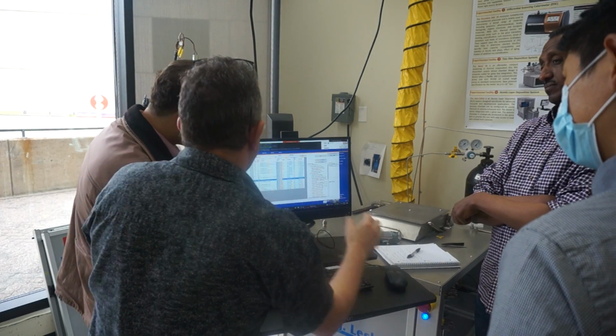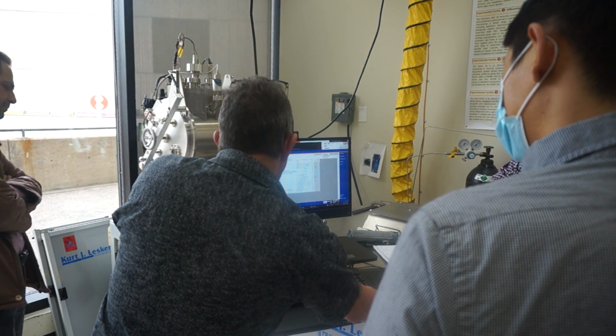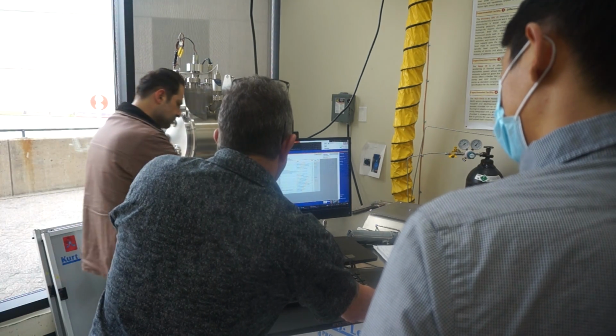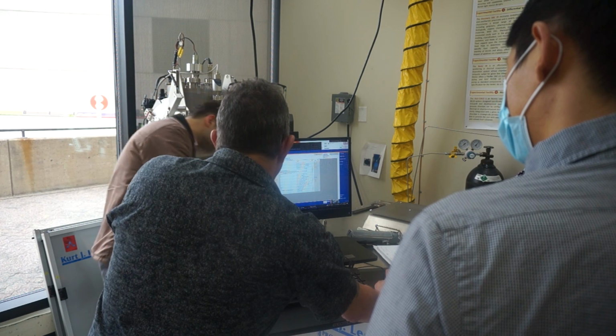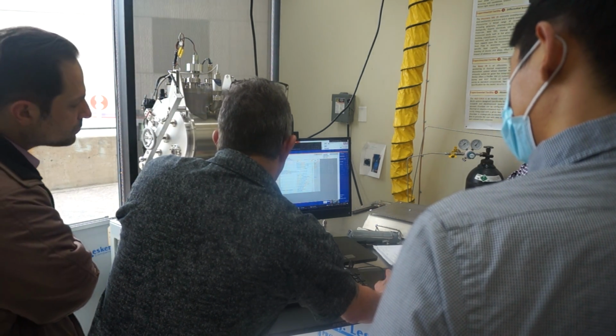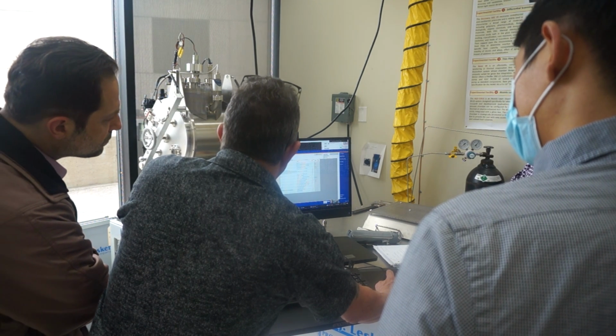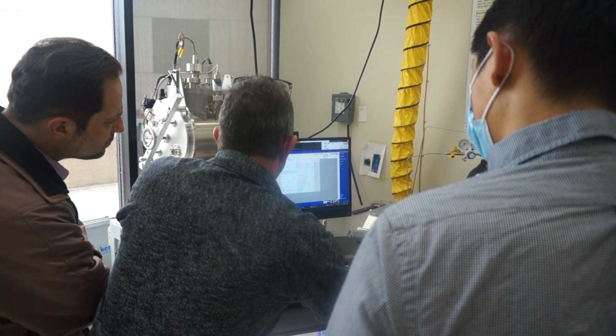But stepping back to this process recipe, it loads up the matrix here with defined parameters. Then it sets the process phase. This is where it zeroes the counter. The current thread, this just changes the speed. The interval, when we see interval, it changes the speed.